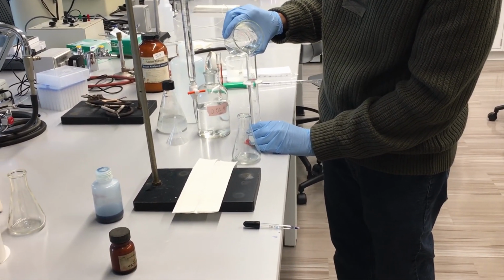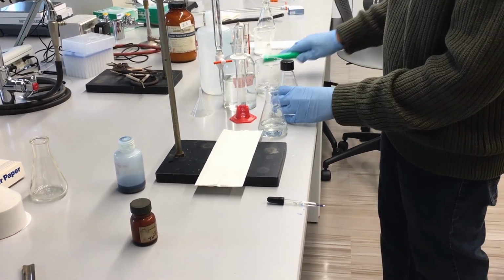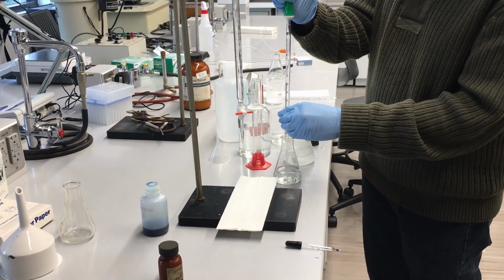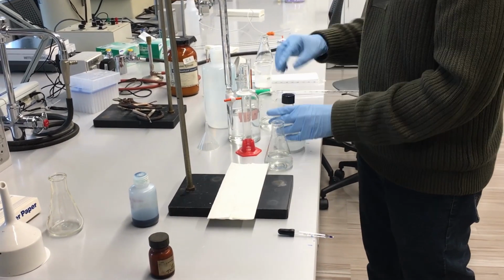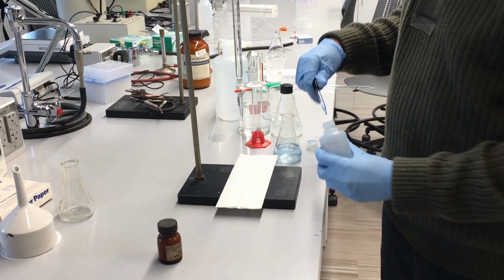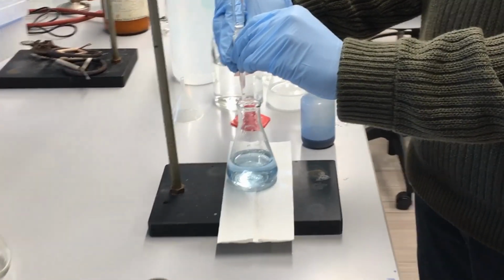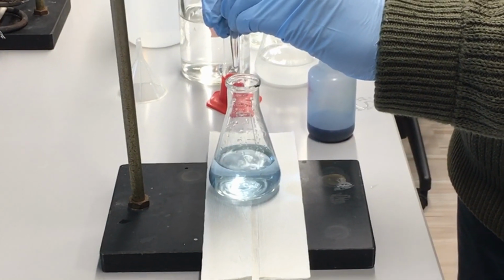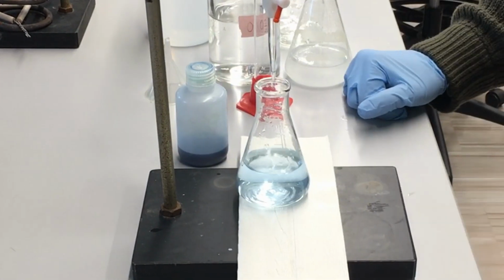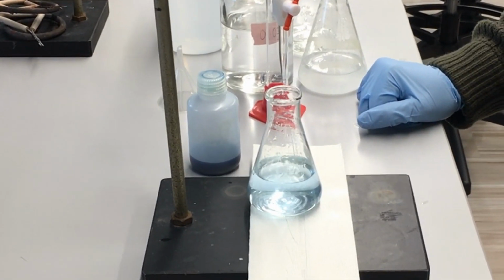And now we will go ahead and prepare our calcium hydroxide by putting in water and taking 10 milliliters of our filtered calcium hydroxide solution, put it into our 50 milliliters of water, and then add some more drops of our thymol blue indicator. And we'll go ahead and start our titration again. And of course, we're going to be swirling during our titration just to make sure that the solution stays homogeneous.